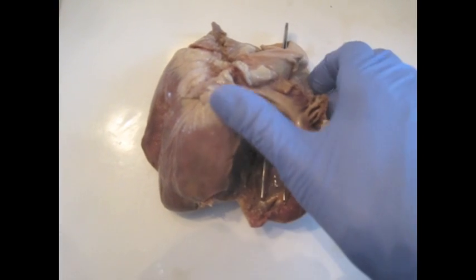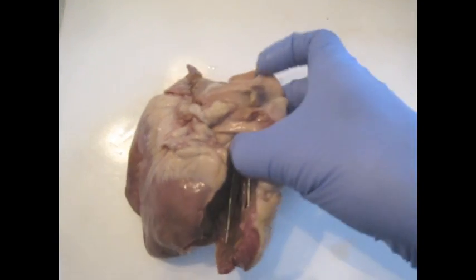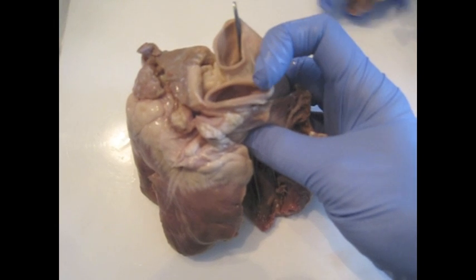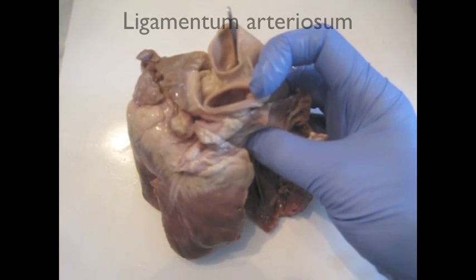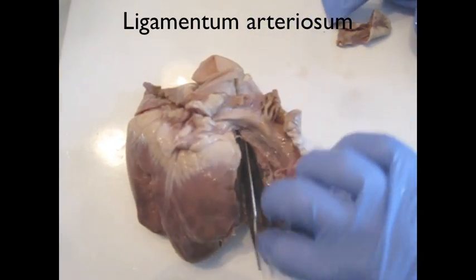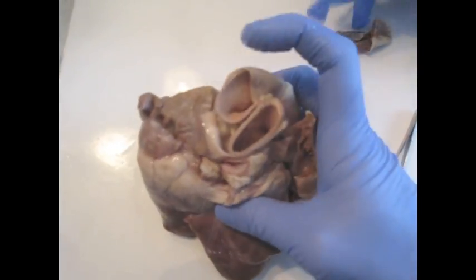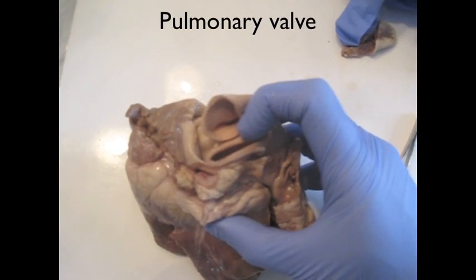I've opened up the right ventricle here and extended some forceps up through the pulmonary trunk. The pulmonary trunk has a thinner wall than the aorta, shown here, and the two are connected by the ligamentum arteriosum. If you look into the pulmonary trunk, you can see the pulmonary valve.